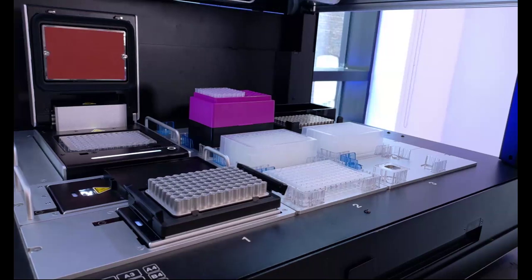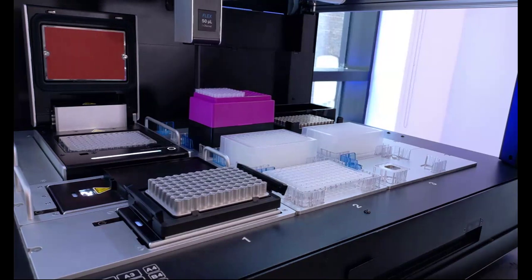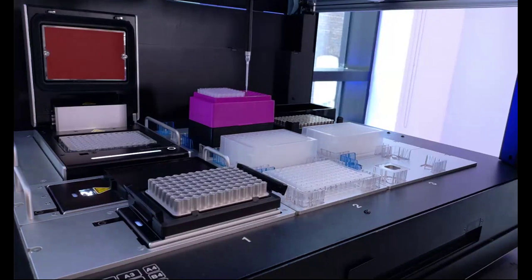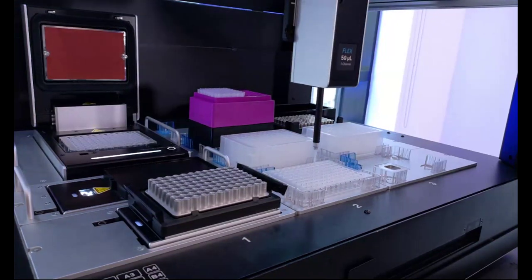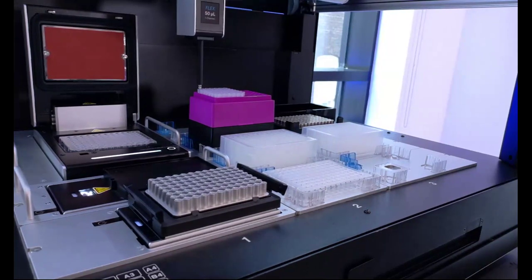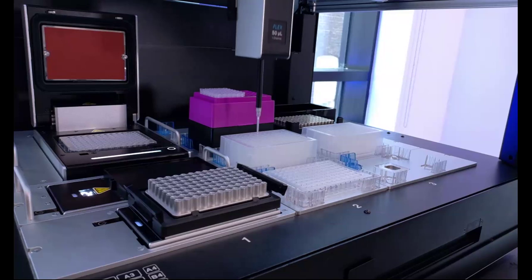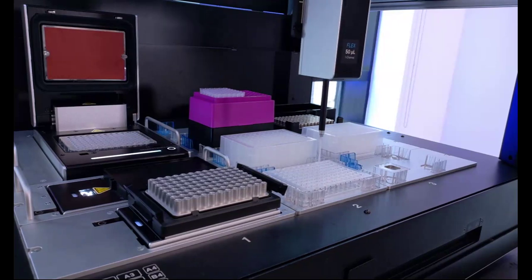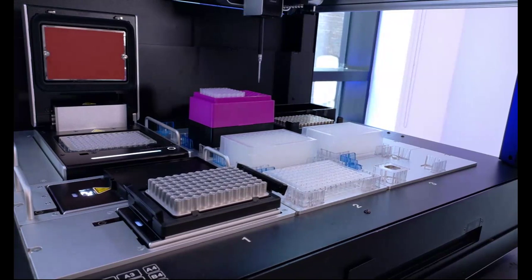And now stopping the share again to show you the instrument. In these two examples, the actual behavior that the robot is doing is pretty similar in terms of pulling from specific, cherry-picked wells to specific destination wells here. But again, the mechanism to set these up was incredibly different. And again, really highlighting the commitment from Opentrons to provide you with solutions that are going to make it a lot easier for scientists to interact with this equipment. Scientists are usually very familiar with CSVs, and having a quick no-code UI experience that's directly on the touchscreen should also hopefully lower the bar to entry and use of the system.